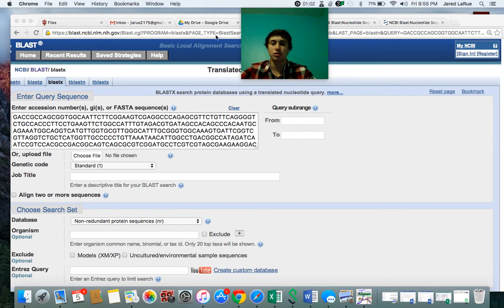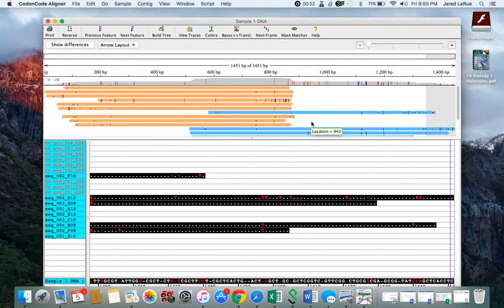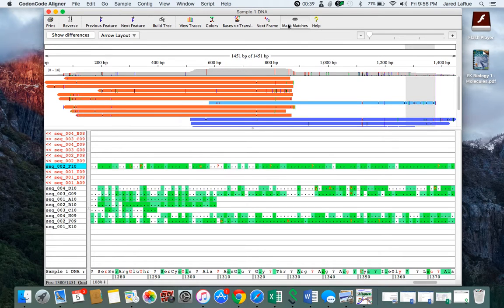And then you just go to the view. Once you go to the CodonCode Aligner, you'll go to view bases, and that'll pull all that stuff up for you. The other thing that's kind of cool in reference to the reading frame is that you can change it back and forth between amino acids and DNA sequence. Whenever you click that, it brings up all the amino acids down here. From there you can do next frame, and that moves the reading frame the program is using to read those. So that's a pretty cool feature.